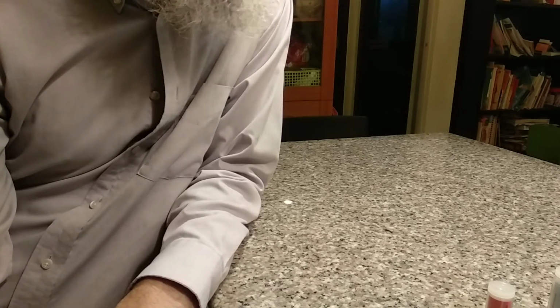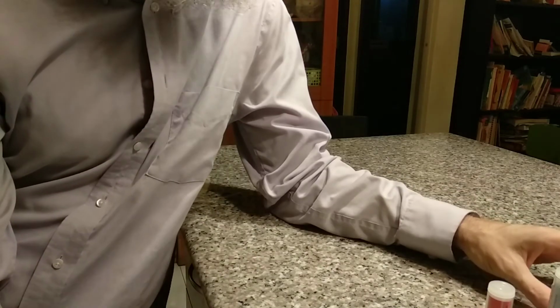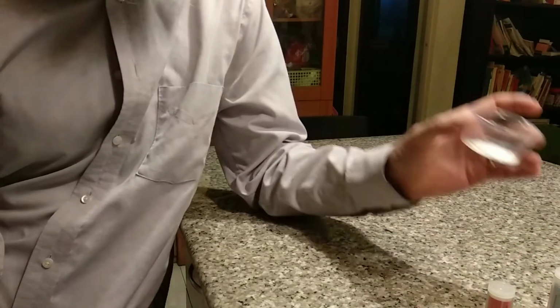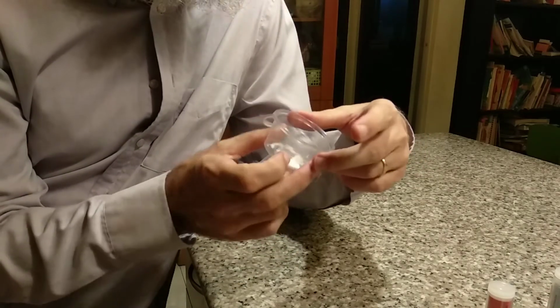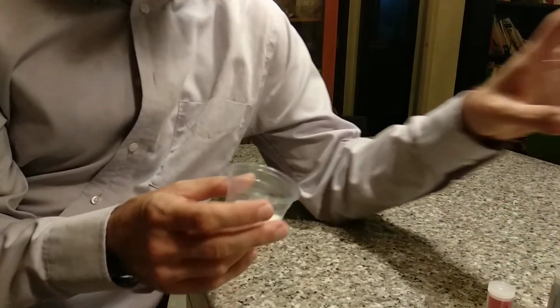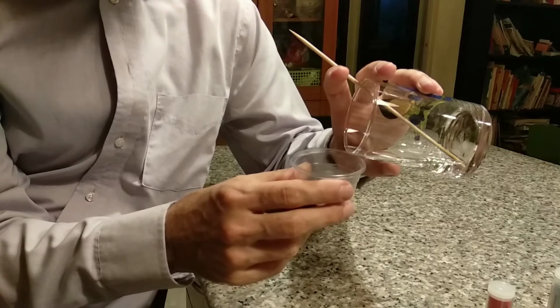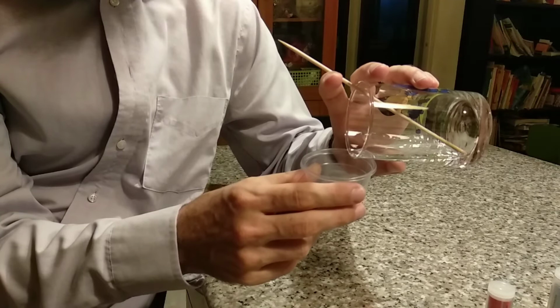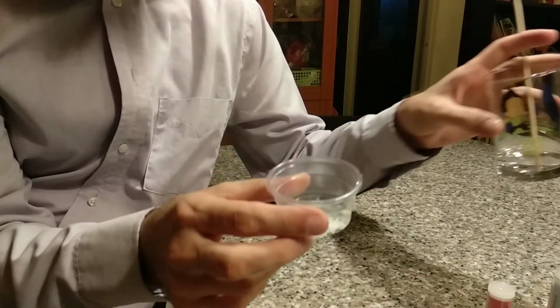One other characteristic that we see is that acids will tend to react with carbonates. So here I have sodium bicarbonate, or baking soda, and if I put a little bit of acid with that sodium bicarbonate, that would be the reaction that we're familiar with. Vinegar with baking soda, right? So it goes sizzle, sizzle, sizzle, and there we are.